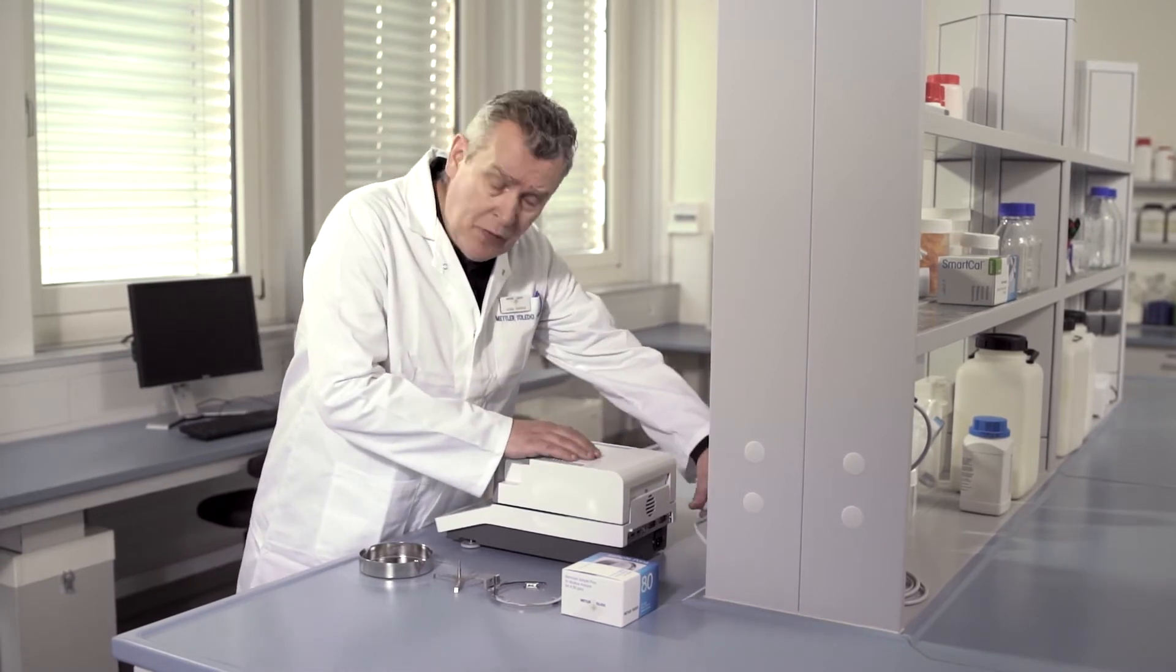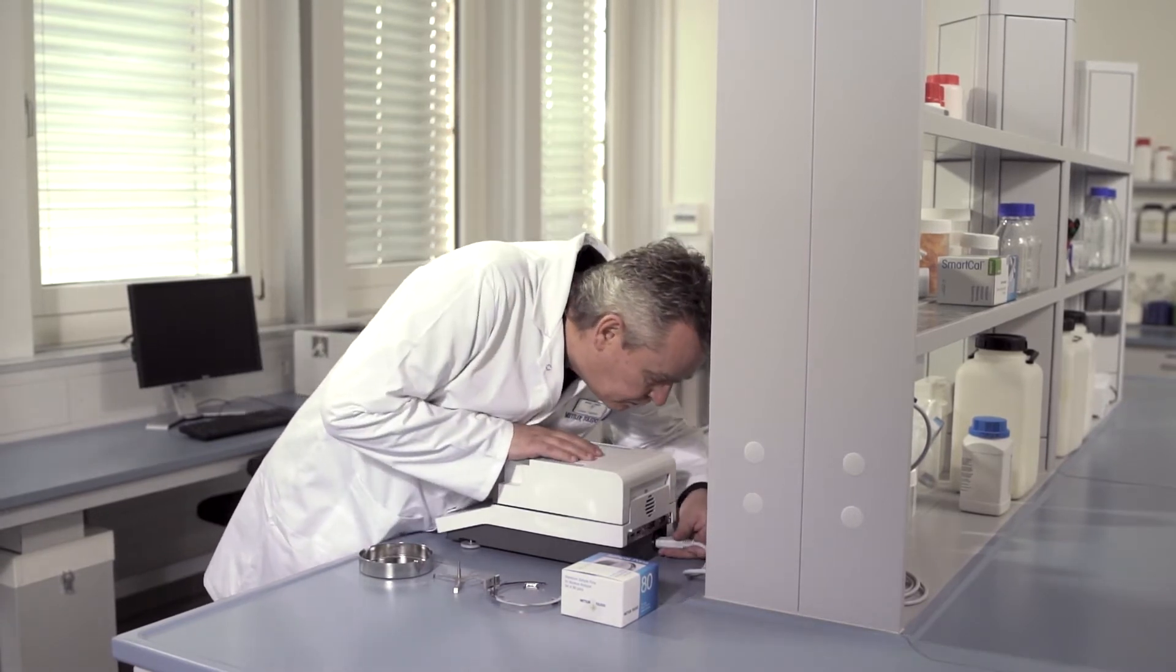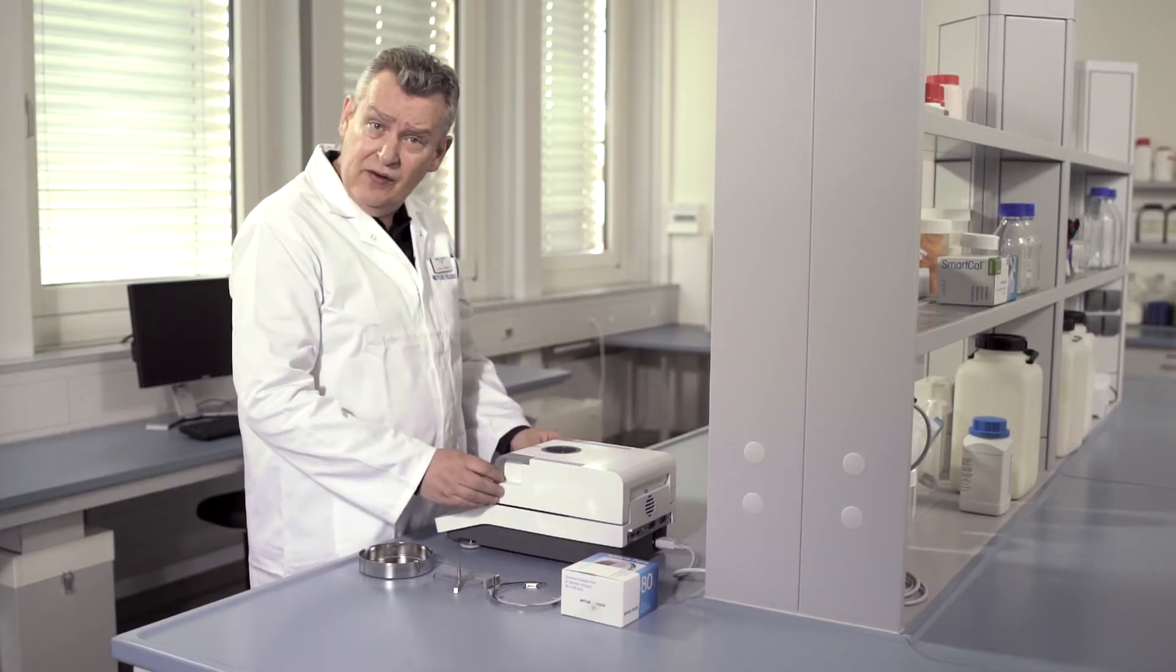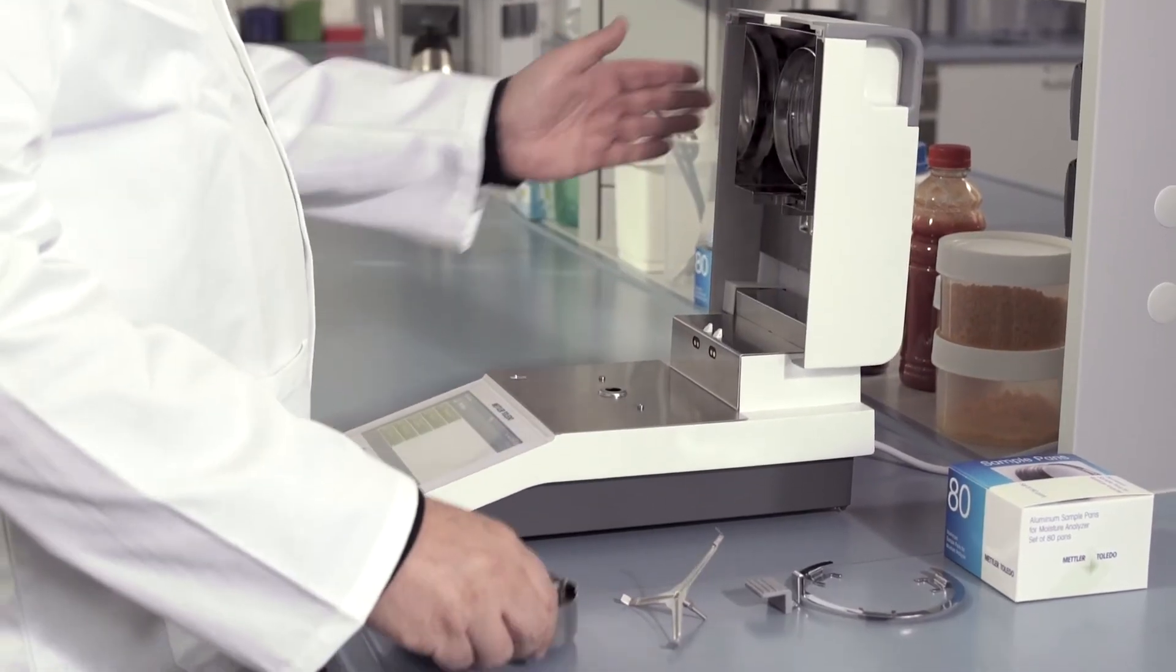First connect the power cable, then open the lid and put the draft shield in place.